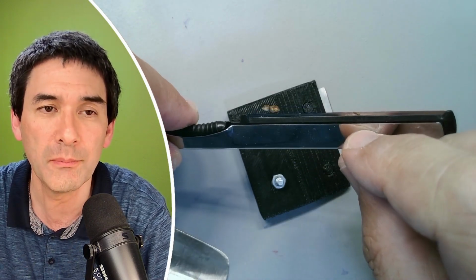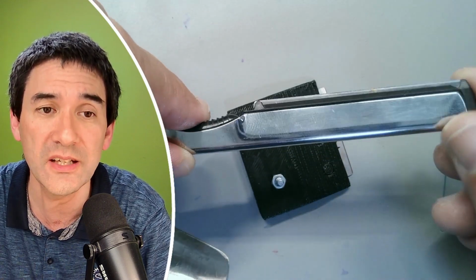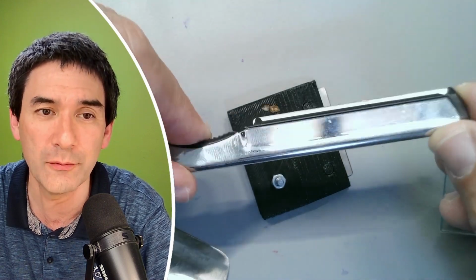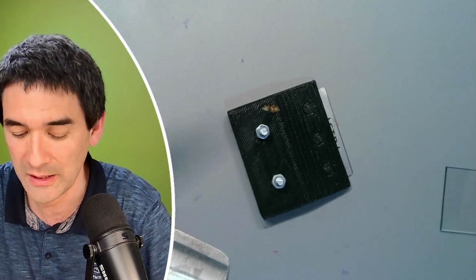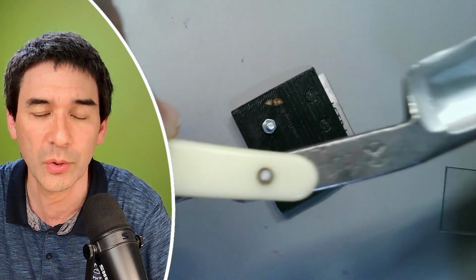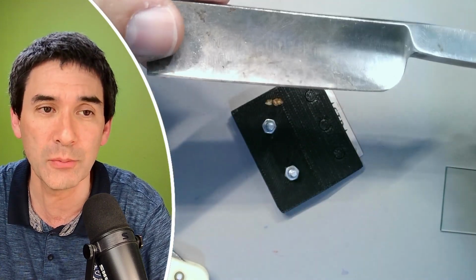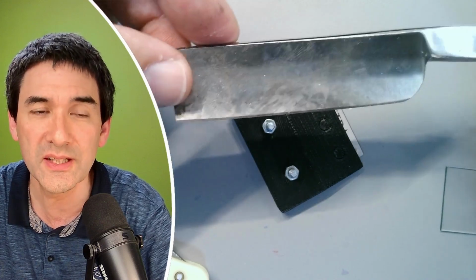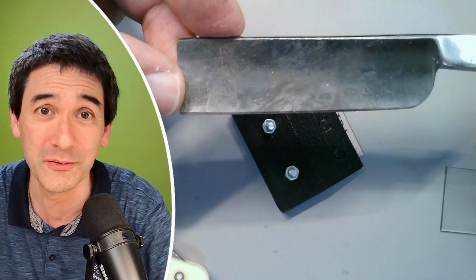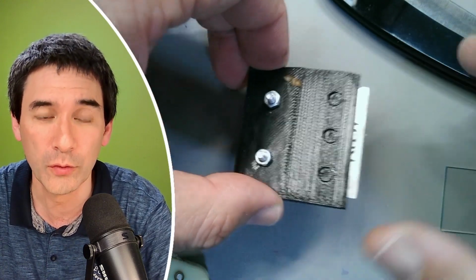This knife here has, however, a disposable blade. So this means that when it becomes dull, you can easily exchange it. However, I think it's not quite as easy to use, because you have to adjust the angle as well. This one over here, as expected, is completely useless. We can just basically throw it away. And this one over here is better. It came along also with a slightly better microtome. However, those knives do have the disadvantage that they have to be sharpened from time to time, and I'm not able to do that, or at least I don't have the know-how to do that. And this is the reason why I decided to move over to disposable blades.